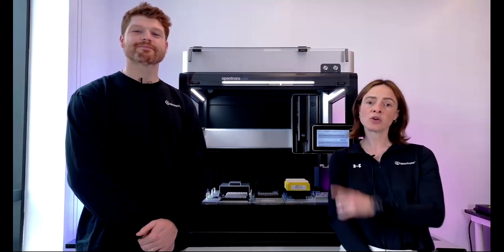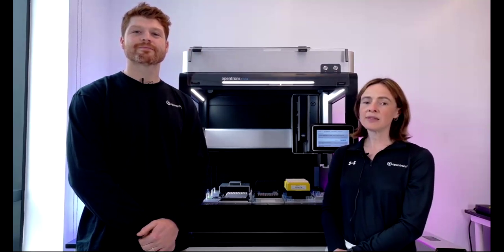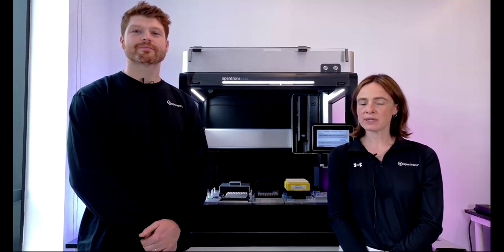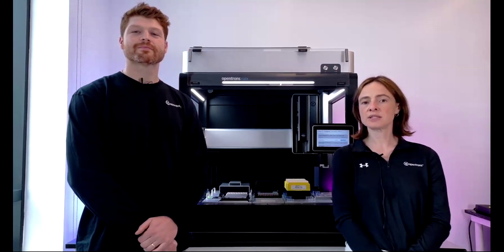Today we'll show you the Opentrons Flex, and we'll talk through some key features, such as the pipettes, the modules. We'll talk about a new hardware accessory that we have up here, and some new software functionality. Then Nick will take you through a demo automating a workflow on the Flex using a protocol downloaded from the Opentrons protocol library. This is a very easy process to get existing protocols, some of which have been verified by our scientists or reagent partners, to run on your robot. And we'll show you how to alter key parameters such as sample number from run to run. And then finally, we'll answer any questions you may have at the end of the demo.